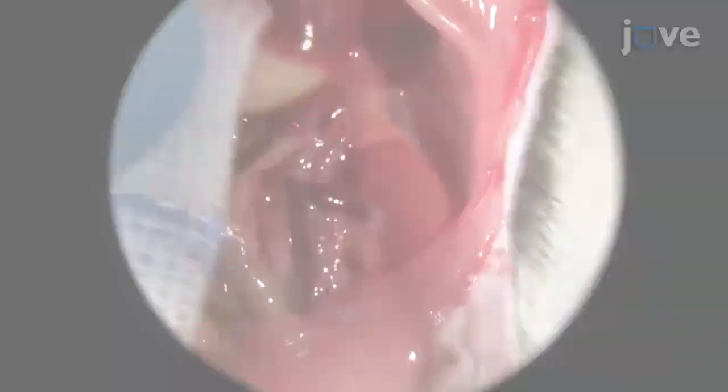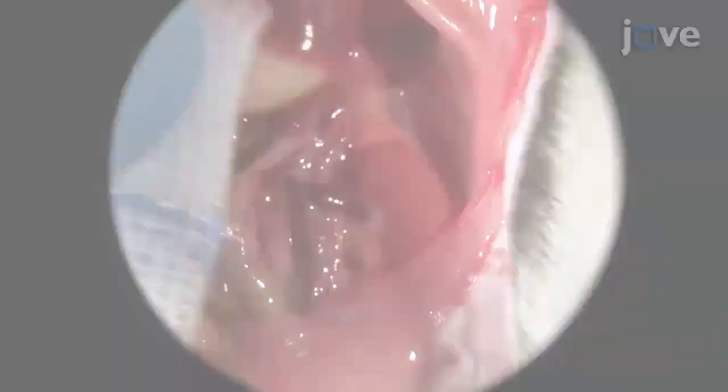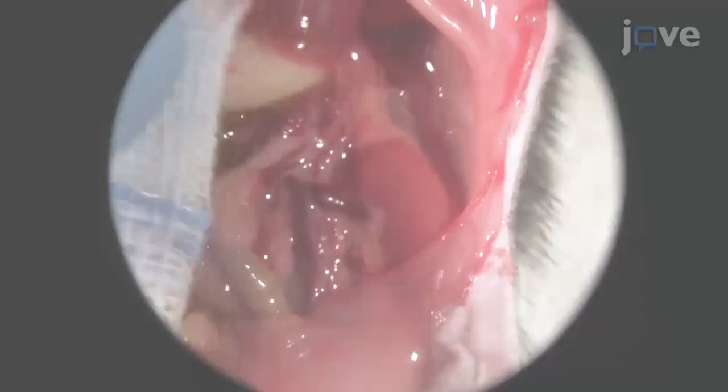Place the animal under a dissecting microscope and use a sterile swab to move aside the visceral organs. Using fine scissors, cut the hepatic phrenic ligament.